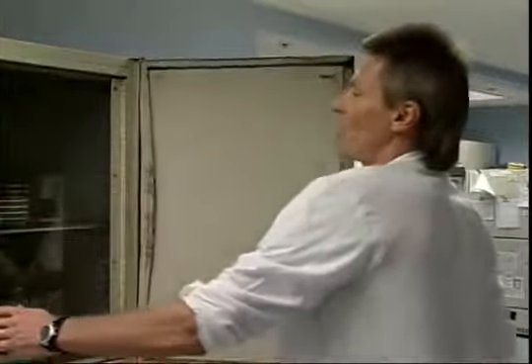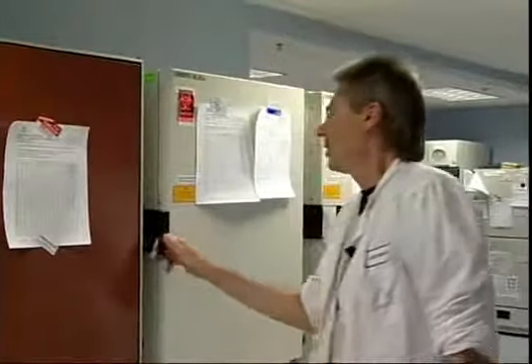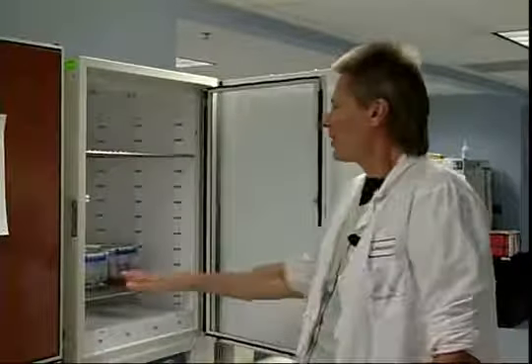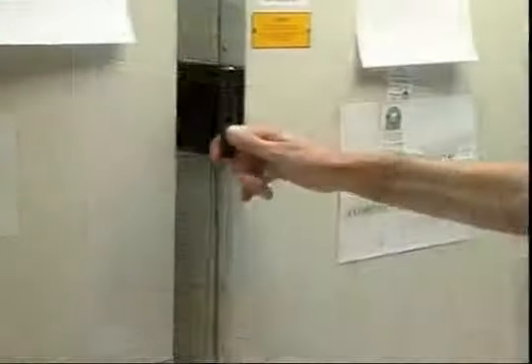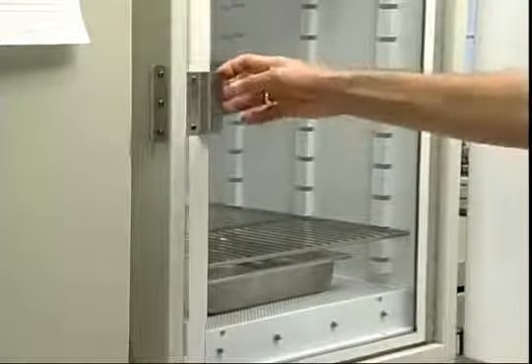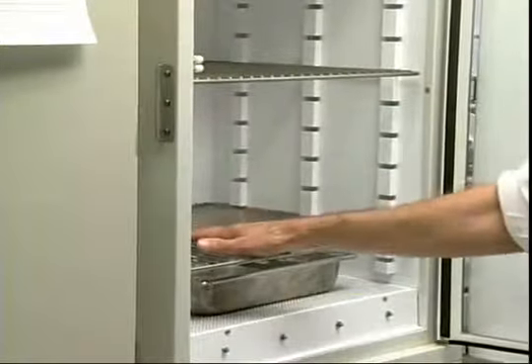We do have a 42-degree incubator for a specific organism called Campylobacter. You've probably heard of that. It's an enteric pathogen. And it's grown at 42 degrees because, number one, Campylobacter prefers it a little bit warmer, and also 42 degrees inhibits all the normal flora that would normally be found in the stool. And we also have a 30-degree incubator, and this is used specifically for yeasts. It's a little bit cooler, and it seems some yeasts prefer 30 degrees to grow. So with this 30-degree incubator, the 42 and the 37, we can meet all the temperature requirements of any bacteria that might cause infection in your patients.